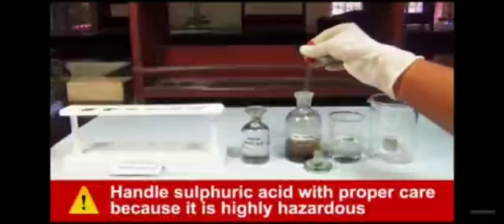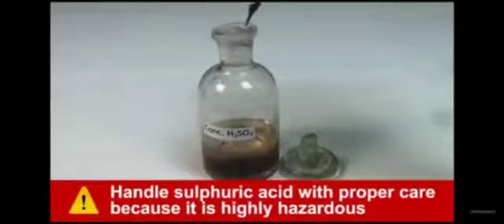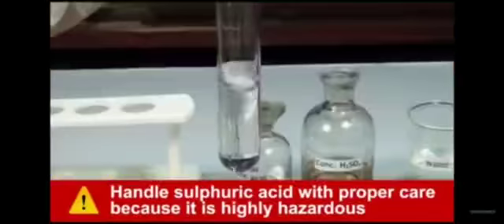Using another dropper, add a few drops of concentrated sulfuric acid to the test tube. Warm the mixture in a water bath for about 10 minutes. Now, pour the mixture into about 20 ml of cold water taken in a beaker and stir it.